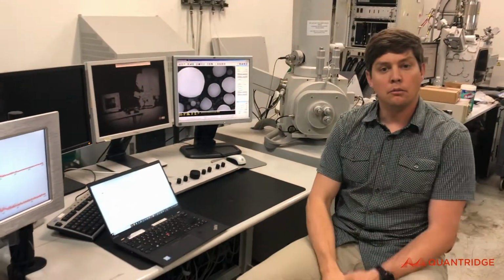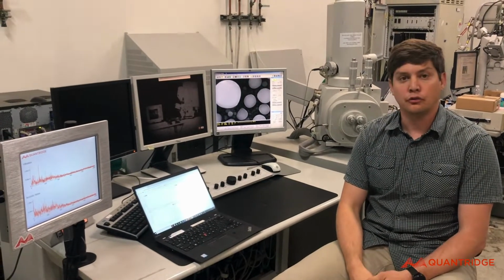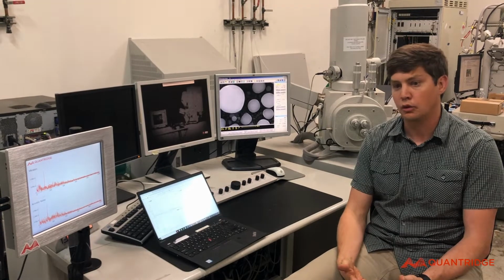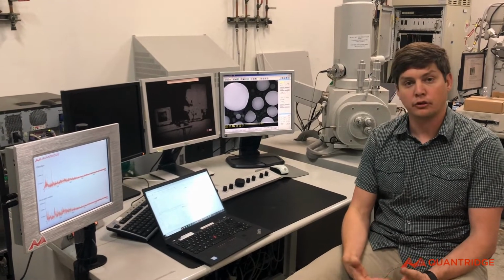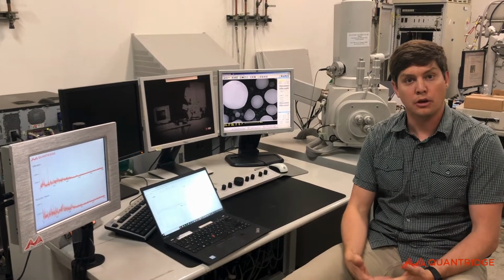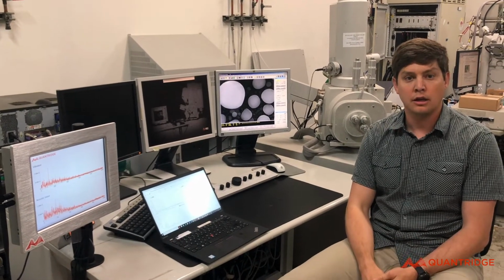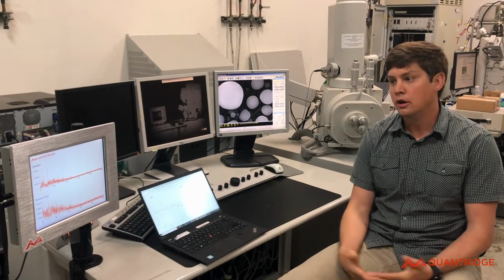So, we think this is a very useful tool, so you can monitor what's going on at your tool location when you're not necessarily there. We think this is very useful for remote imaging or understanding what's going on in your facility 24 hours a day to monitor production.